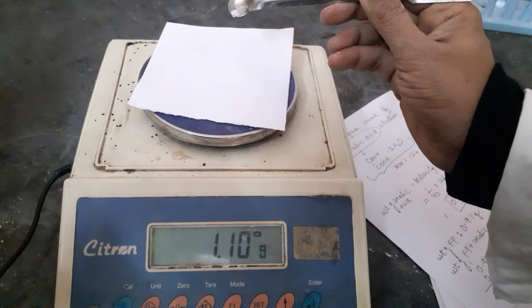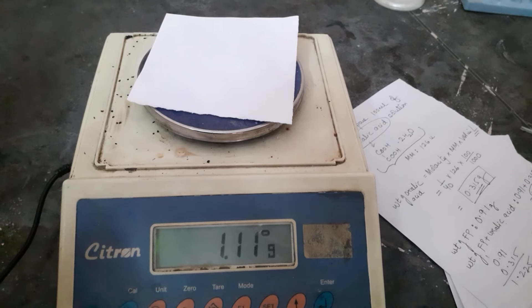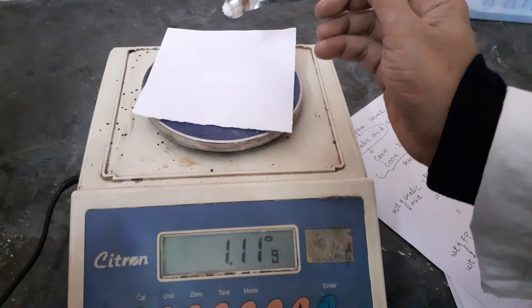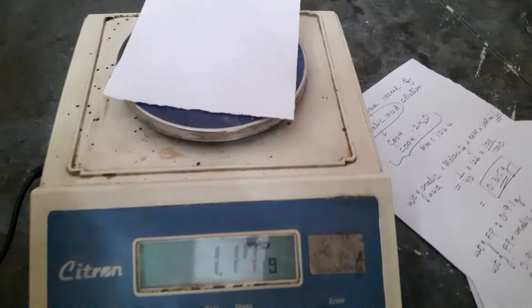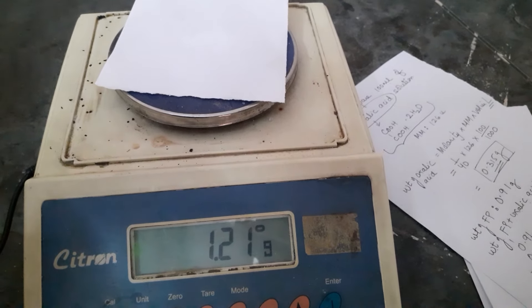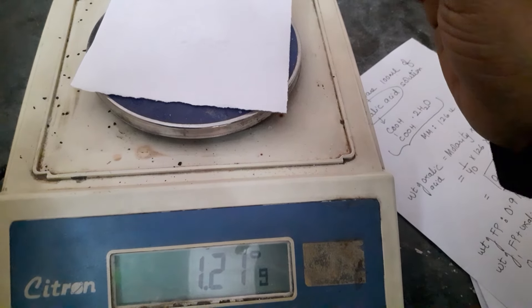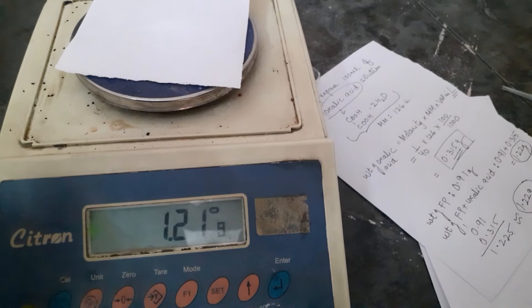Let the value increase slowly towards 1.22. It is at 1.10... 1.11... adding a little more... 1.18... 1.19... 1.21... just a tiny bit more so it reaches 1.22. If it goes slightly over, don't worry — it is quite difficult to do this precisely. Let's see if it goes to 1.22 — okay, it is ready now.